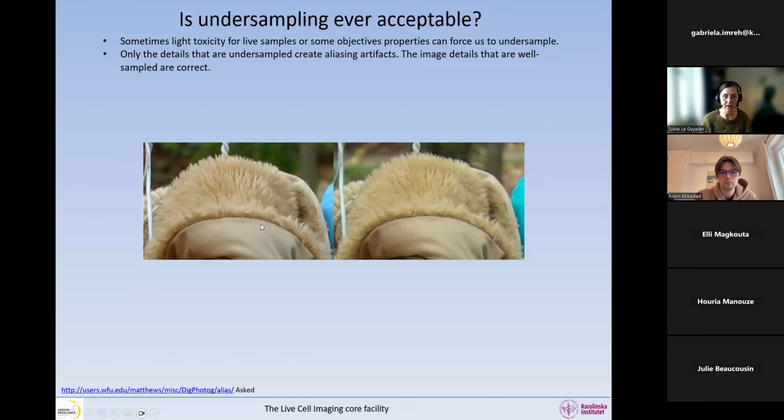If you can see in these 2 images, this one is undersampled and this one is sampled correctly. You can see some moire artifacts here because this fabric has very fine details, so it is undersampled here. Whereas this part has very coarse details in this image, and so it's properly sampled. So we have no artifacts here. Only the details that are undersampled create aliasing artifacts, not the structures that are correctly sampled. So you can see coarse details, no artifacts. Fine details, we get more artifacts, okay?